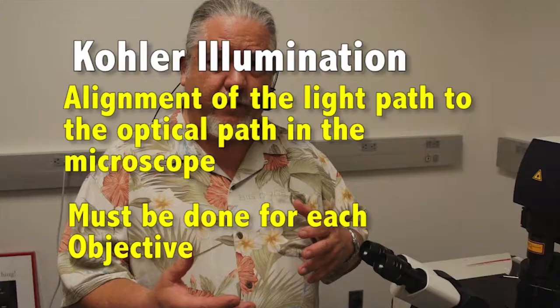As mentioned previously, Köhler illumination, or alignment of the light path to the optical path in the microscope, is very important. You must do it for each objective that you're working with.